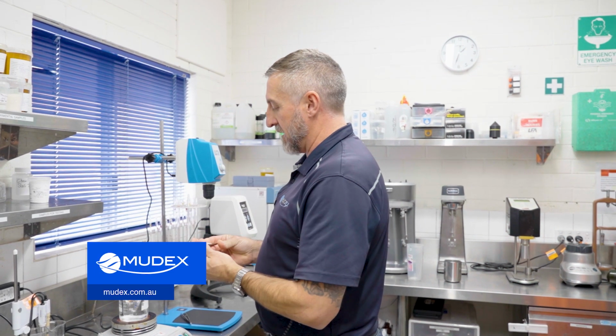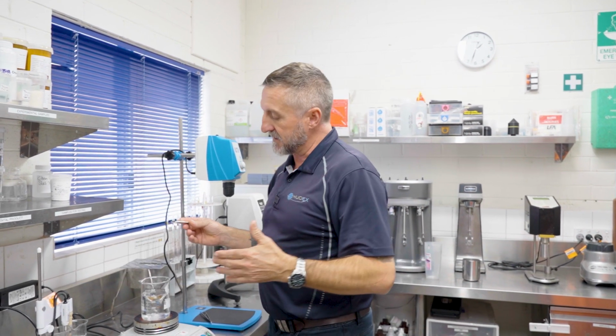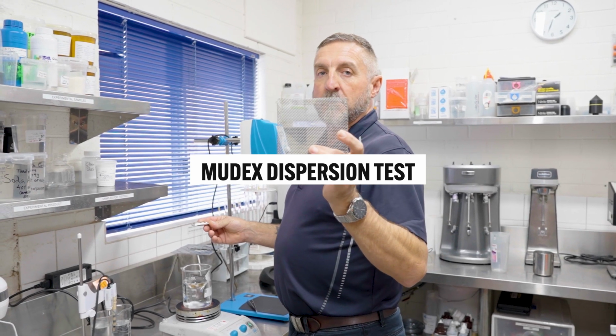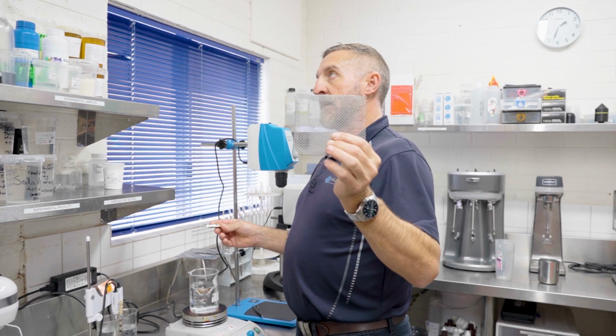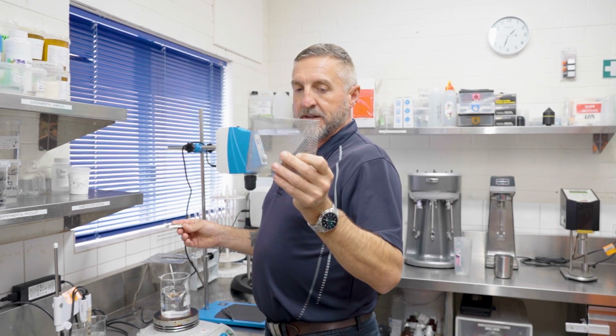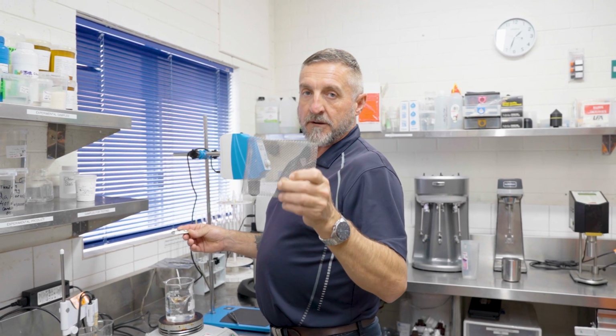So this is doing the Mudex dispersion test. What we have is a screen with a 1.9mm aperture running about a 0.5 mesh wire. So it's a woven mesh wire. The direct numbers and everything are in our procedure.